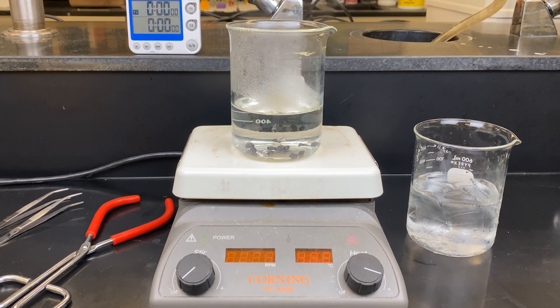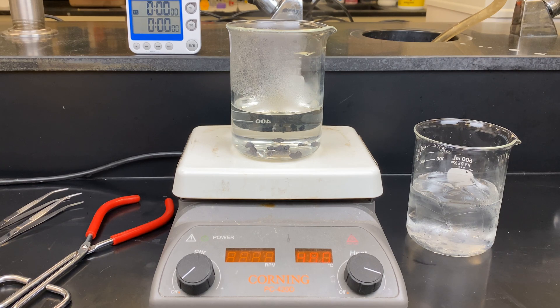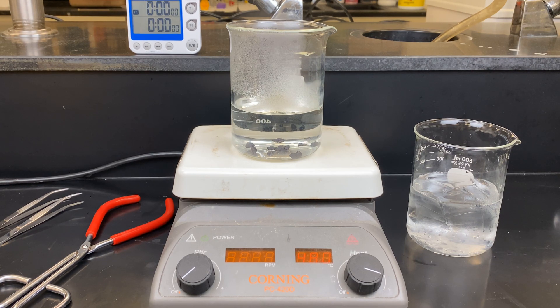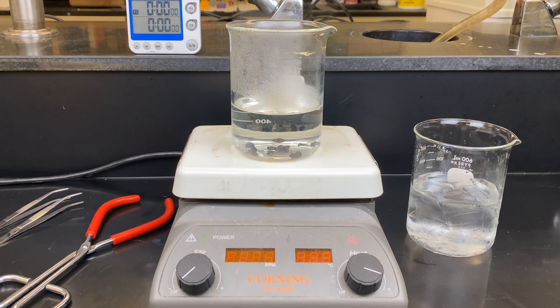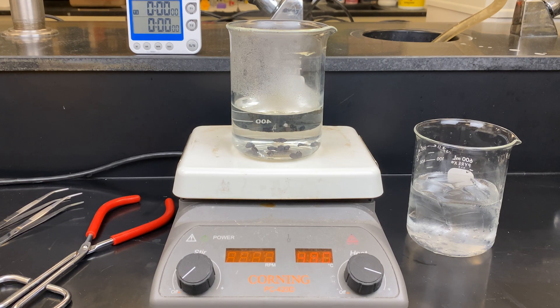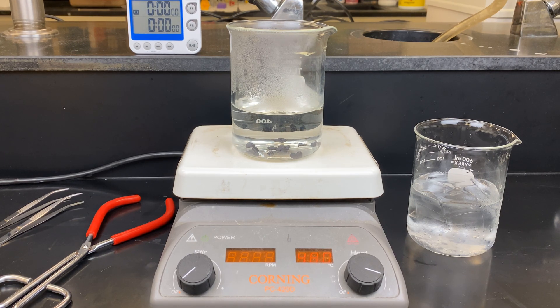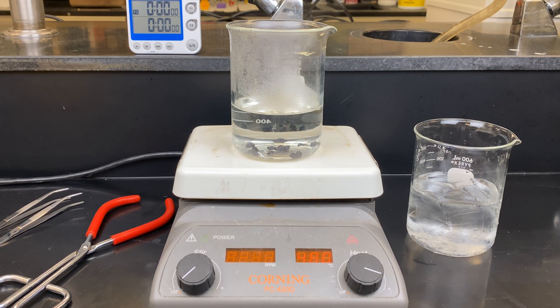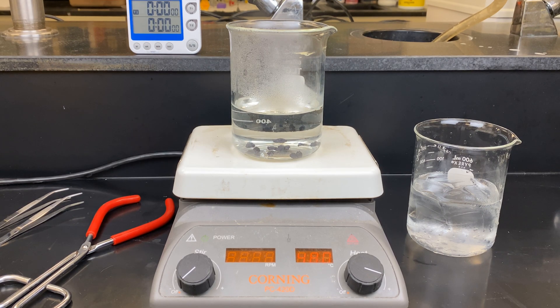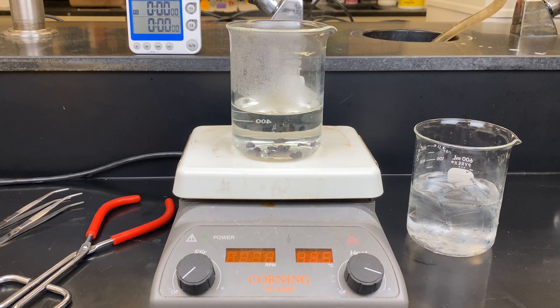We will heat the samples in a beaker of water on a hot plate. Remember to add your boiling chips for safety reasons. We'll have a beaker of ice water to stop the heating process, as well as beaker tongs to safely remove the heated beaker from the heat source when time is up.